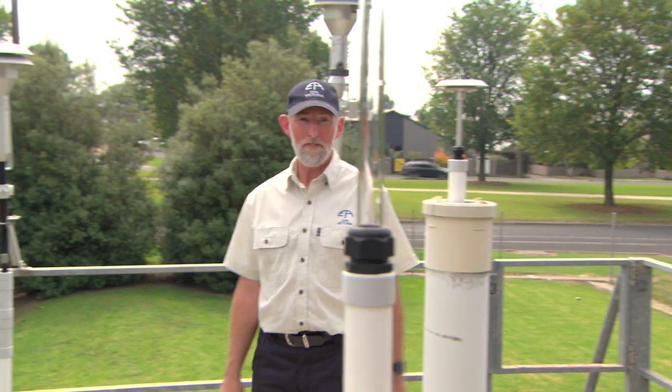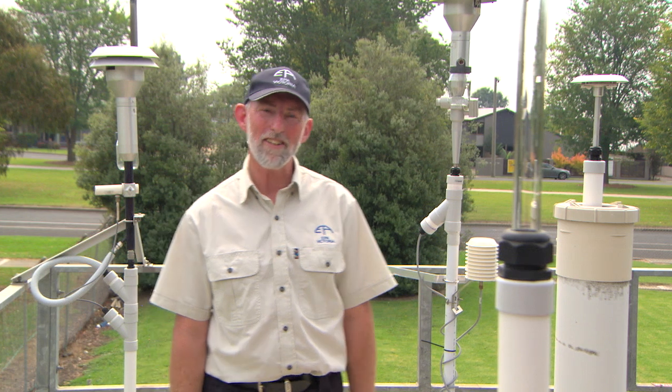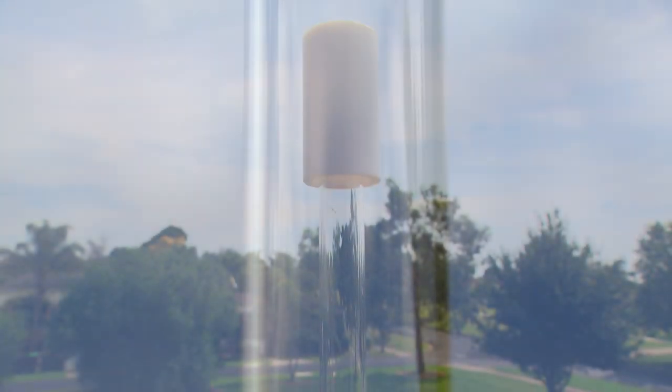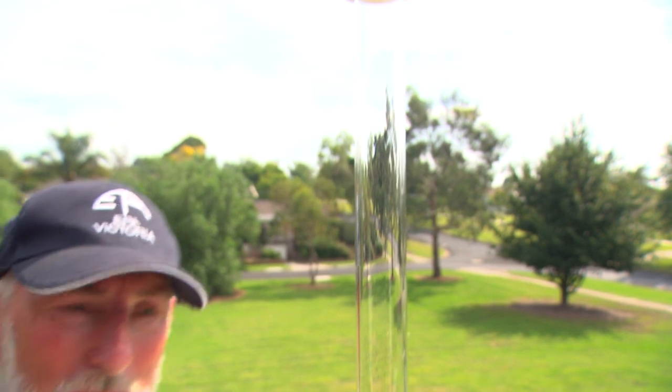On the roof of an air monitoring station you can see a number of inlets. These inlets are connected to instruments inside the station. This glass inlet is connected to a number of instruments which measure gases such as ozone, carbon monoxide, sulphur dioxide and nitrogen dioxide.